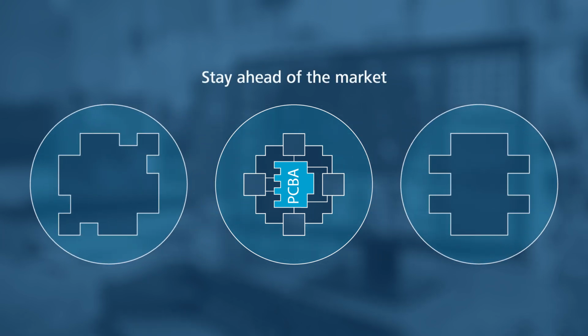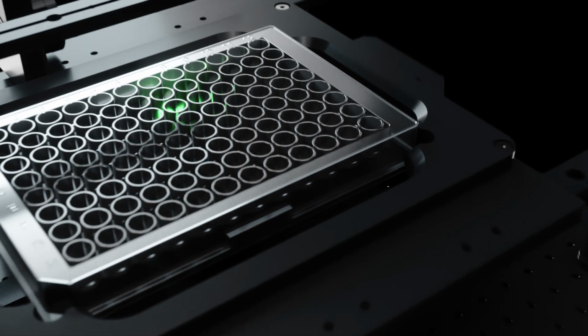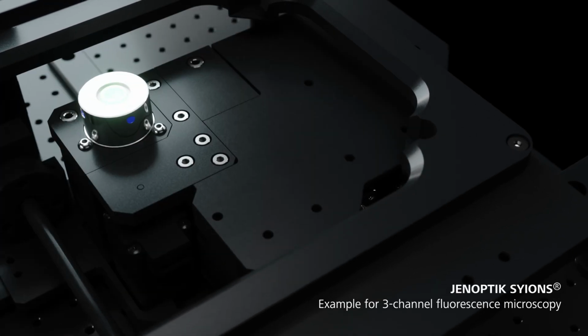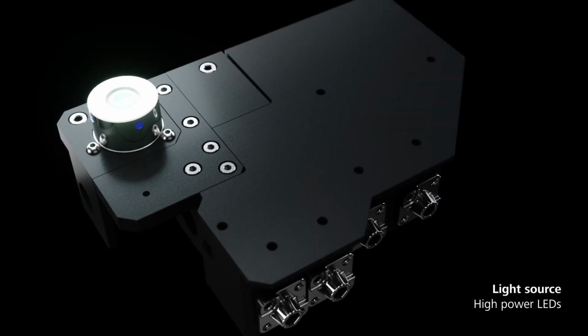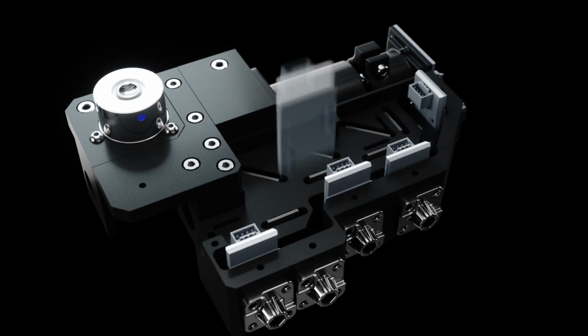Stay ahead of the market and realize new market requirements faster with less hassle. See how your customized SYIONS solution could look. For example, multi-channel fluorescence microscopy with high-power LEDs and aligned filter sets for creating the perfect image.